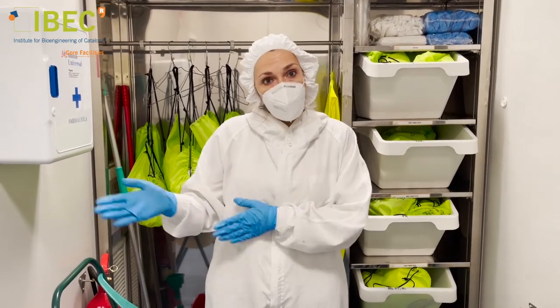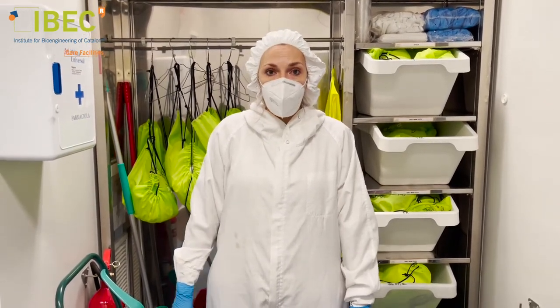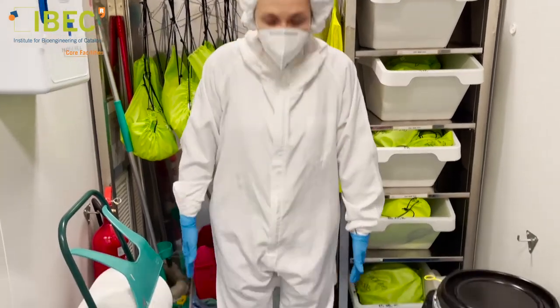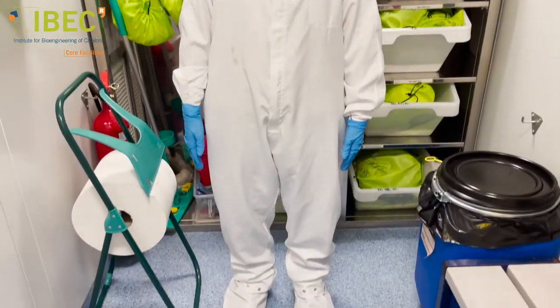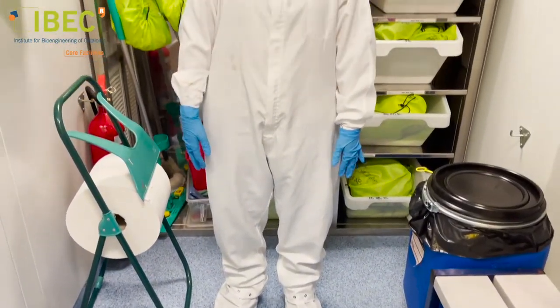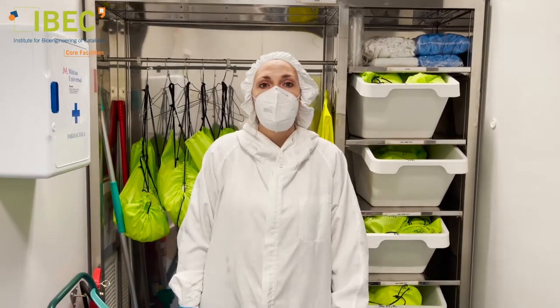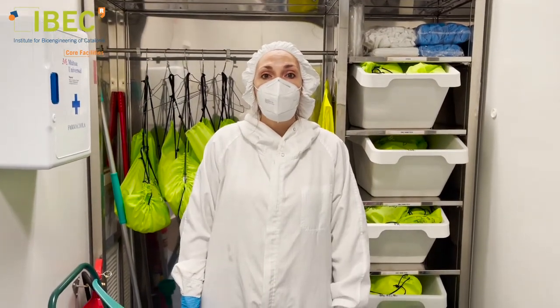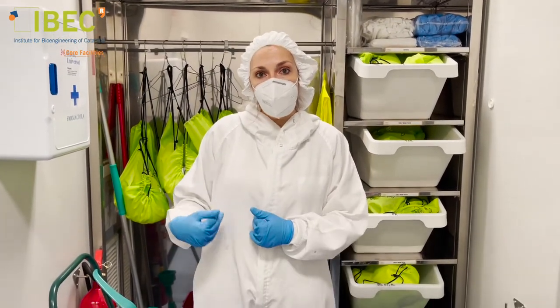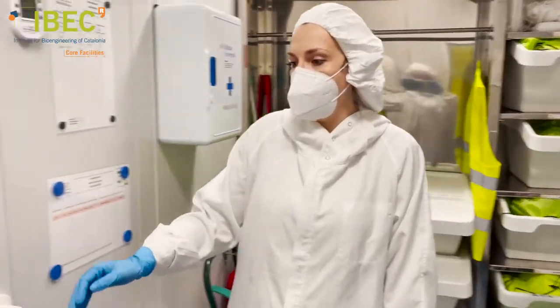Now let's see how our clean room looks. Before entering, we should dress with lab suits and covering accessories to keep the cleanliness inside the room. Let's go inside.